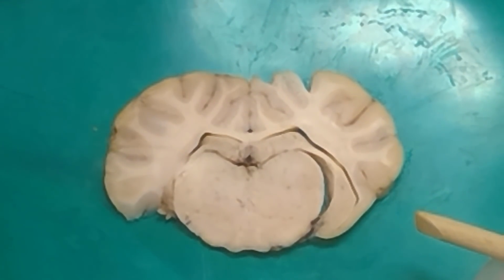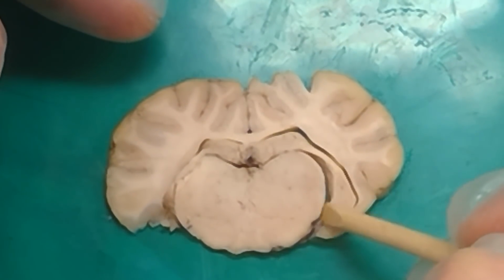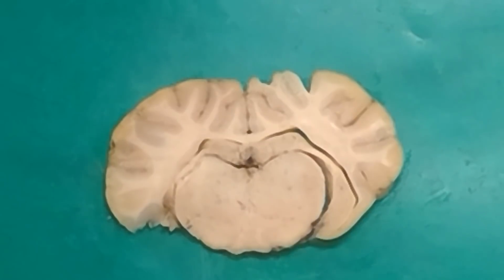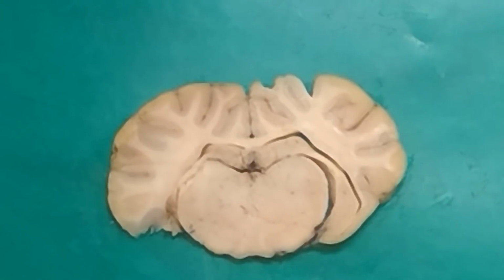Can you see the lateral? Yeah, the lateral geniculate is this large half moon. You can see these are the optic fibers here, and that's where they're going to be synapsing, on this. It starts out as a wide bump that becomes a narrower bump towards the back. But if we're asking anything like, name the specific nucleus on the lateral side, it's probably the lateral geniculate we're asking about.